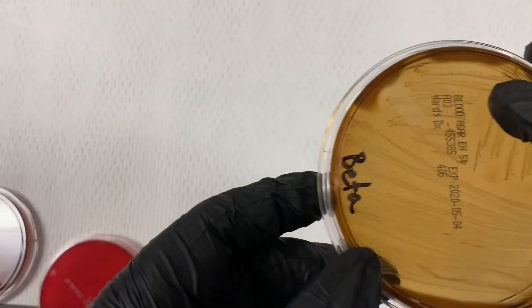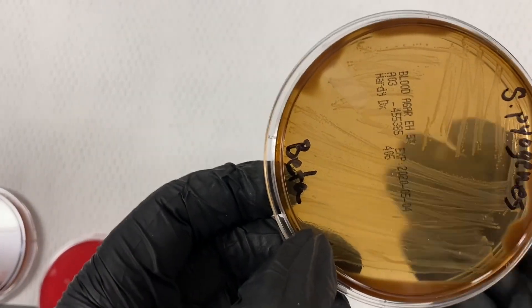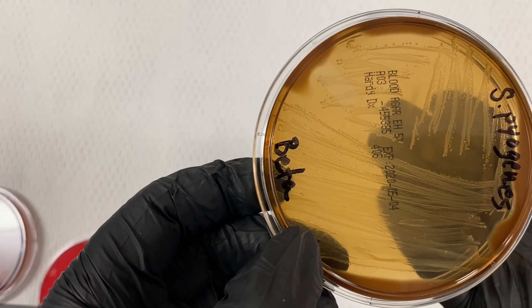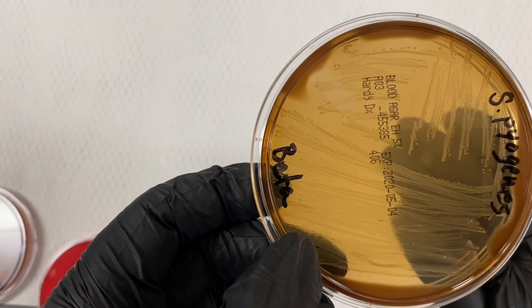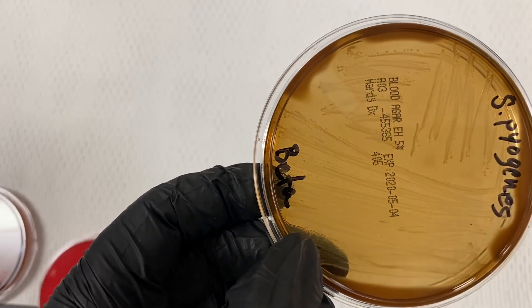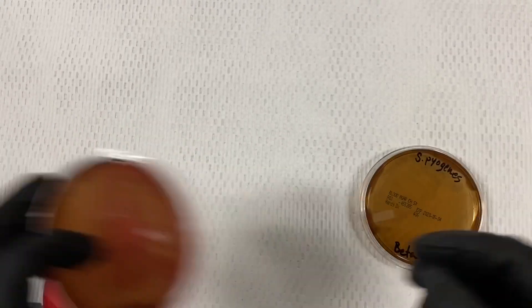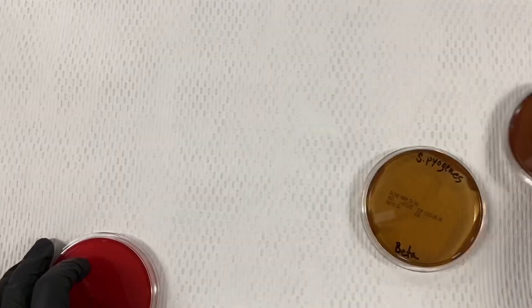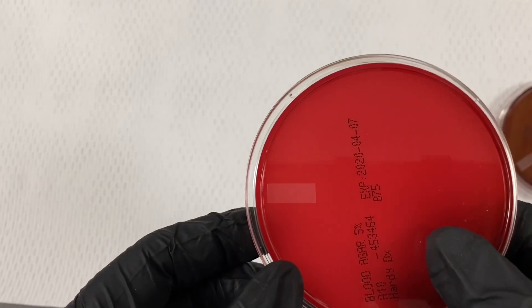And then a more complete or thorough removal of the blood by hemolysin — in this case beta hemolysis versus alpha hemolysis — compared to its original state.